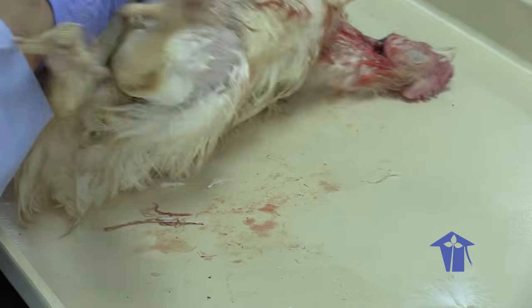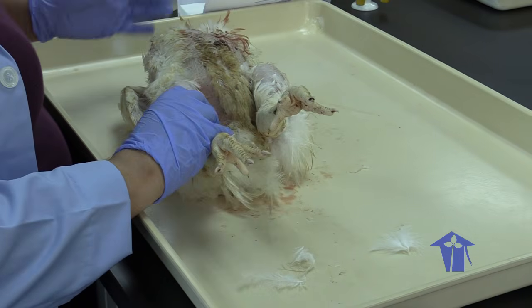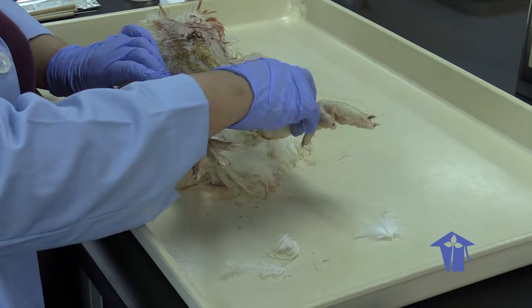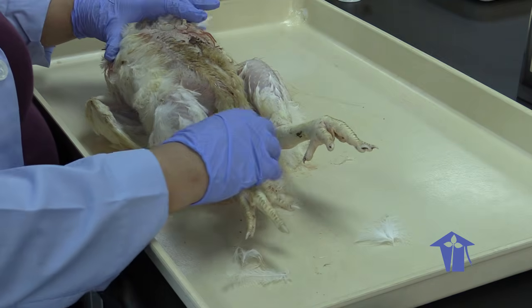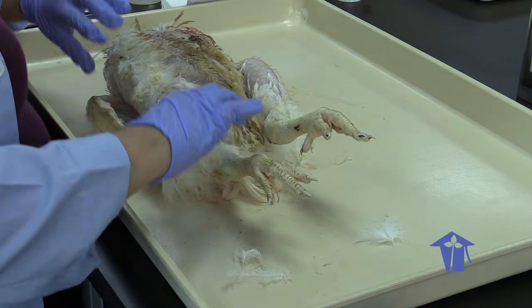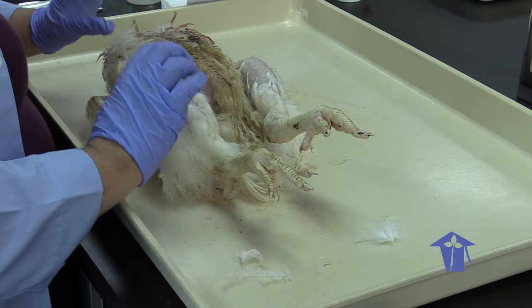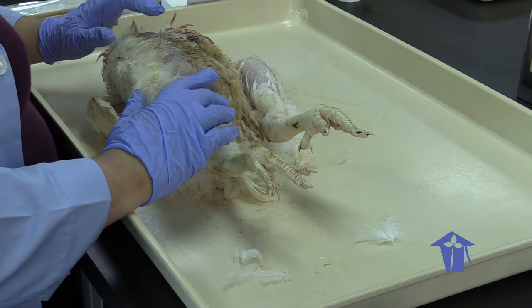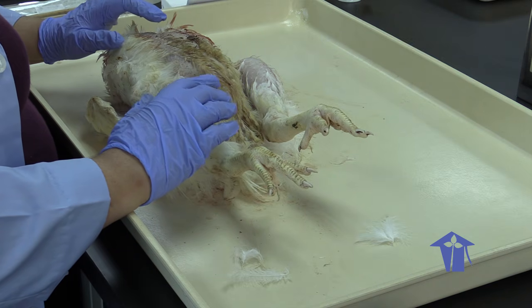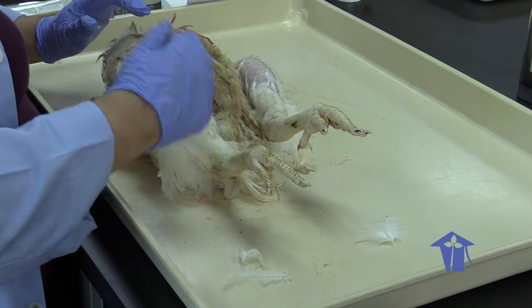So we are now going to cut this guy open. When we're dissecting a vertebrate, we normally cut ventrally, so we cut basically up the belly, right? When we're cutting an invertebrate, we cut dorsally, so we'd put it face down and cut the back. But for a vertebrate, because the vertebral column blocks most of the organs and can't easily be removed without causing serious damage, we do not cut dorsally, we cut ventrally.